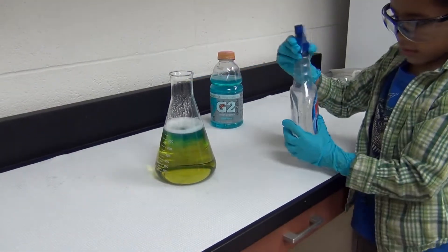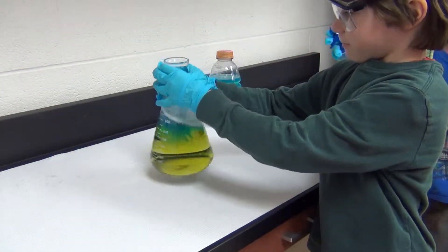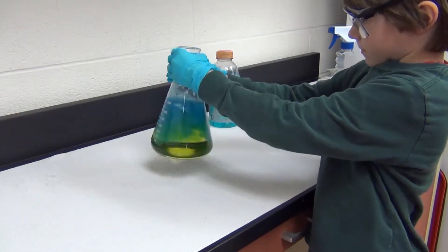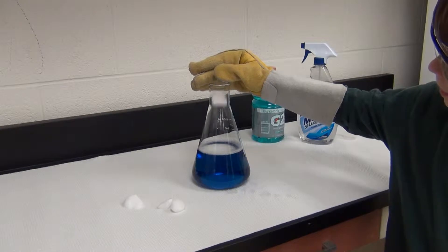One of the easiest ways to measure pH is by using indicators. These are chemicals that change color with varying pH levels. The indicator used here is yellow when the solution is acidic, blue when the solution is basic, and green when the solution is neutral.